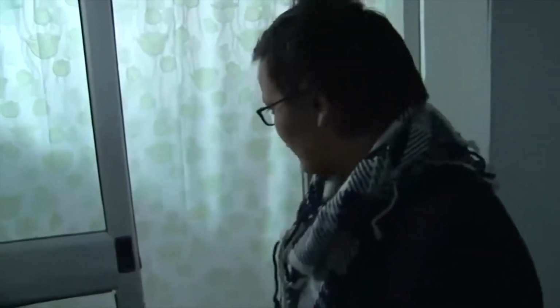So welcome all. We'll be looking into a few model organisms which are already there in our department, and we'll talk to the respective people who are working on them. So can you come in? Just want to see.